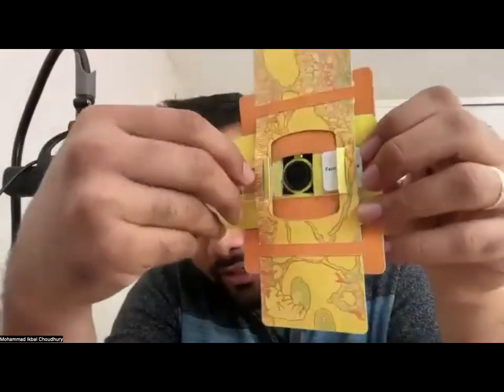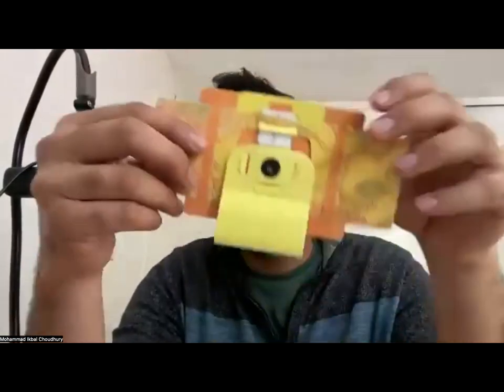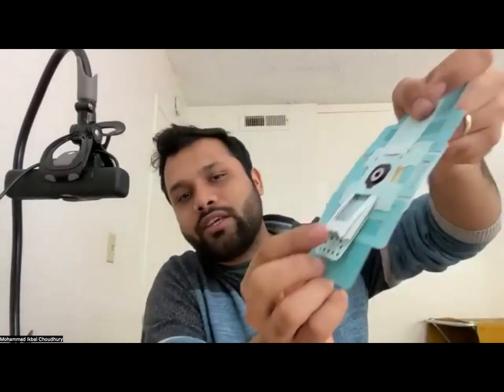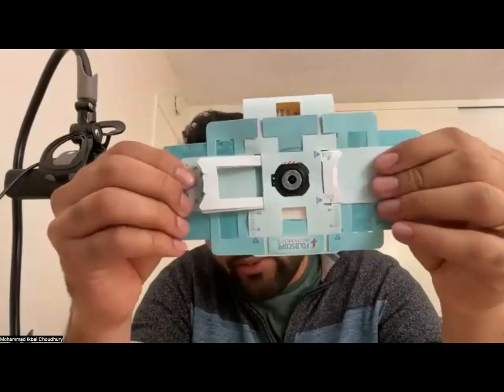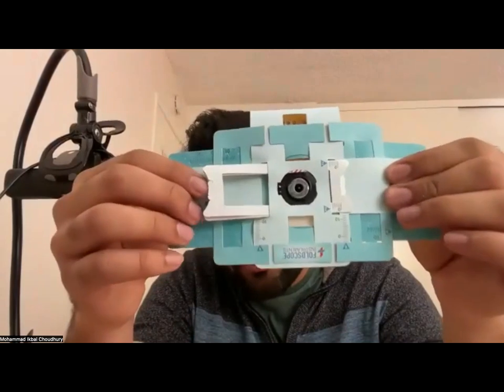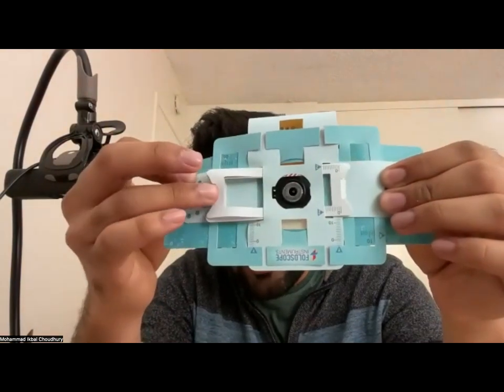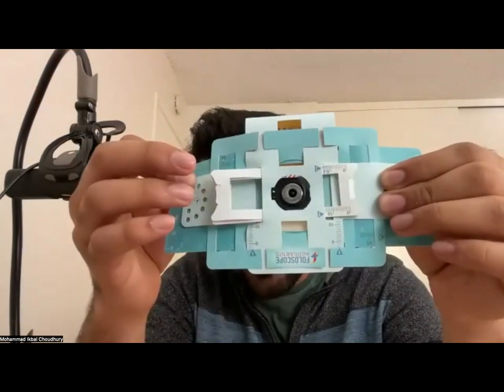I checked that. And then once you close this flap, you point it towards your eye, and I can't see my sample either. So what I'll do is move this wedge here while keeping the XY in position. If you move the XY, it will basically move your lens away from the sample. So if you keep the XY fixed like that, you have to push the wedge like this. You can push the wedge in and out, and that will help you focus on the sample.